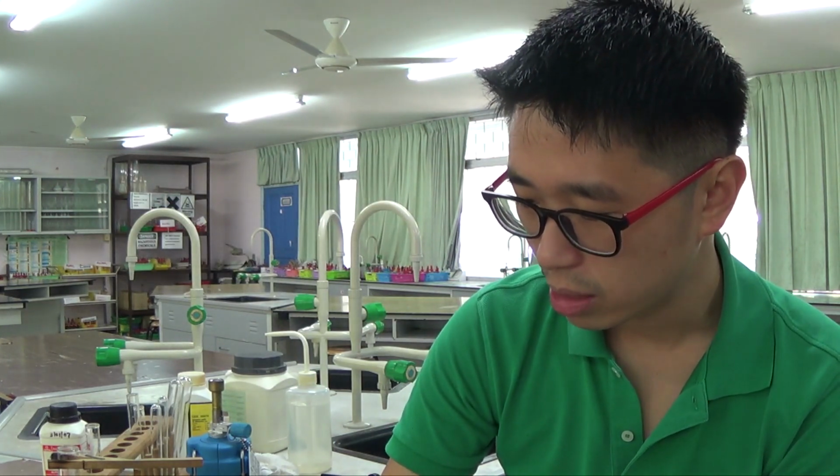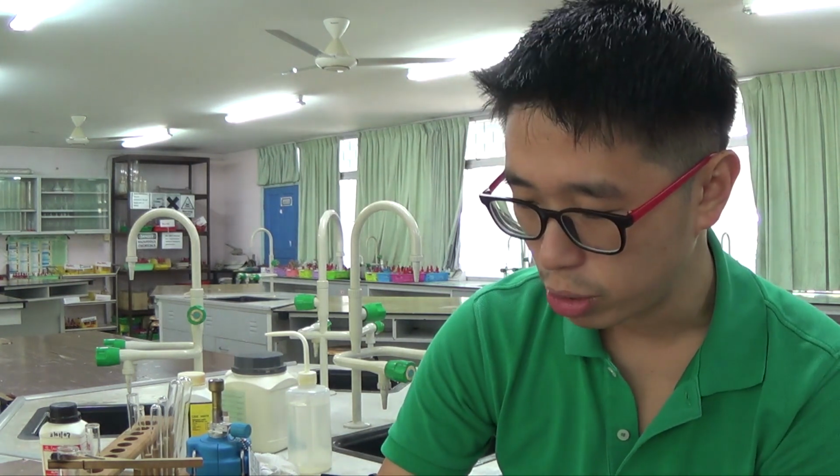Even if you haven't done this practical before, it's really important that you can appreciate the complexity as well as the dexterity in terms of your hand-eye coordination. What are you looking for? What are you not looking for? A lot of students lose marks in qualitative analysis because they lack details. They think they must know everything, but it's more about analysis.